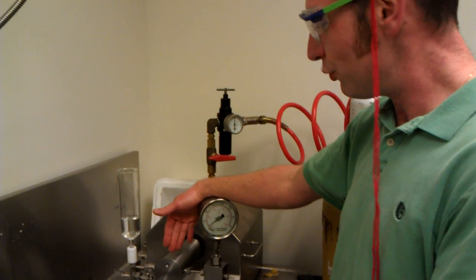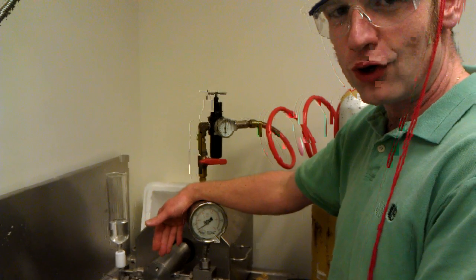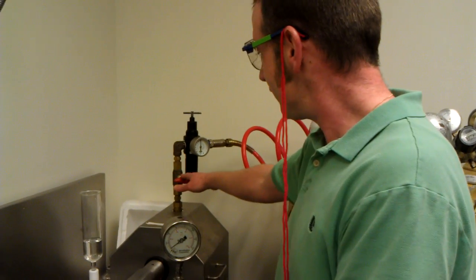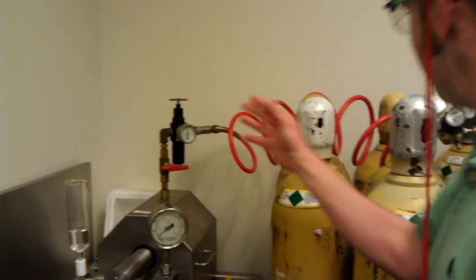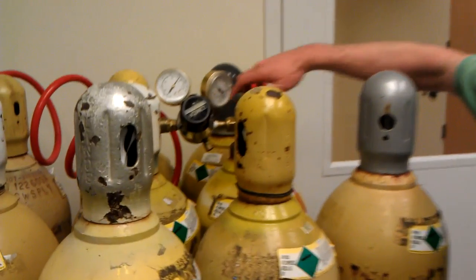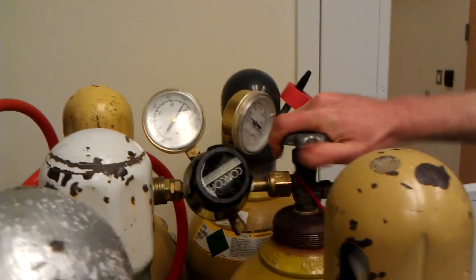Once you're finished with your sample, make sure you rinse it off like you would normally. You would turn off everything here like it is now, and then make sure to turn the tank off here by turning this lever all the way off.